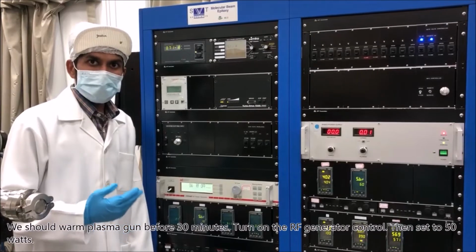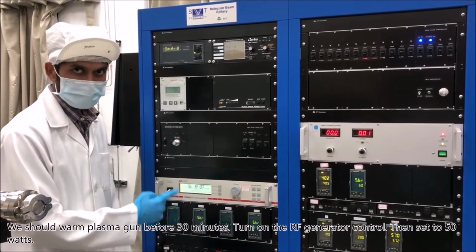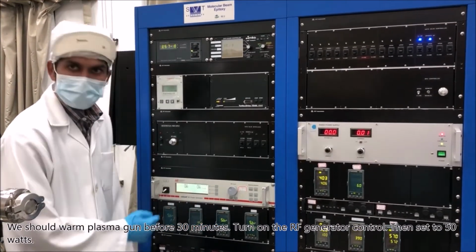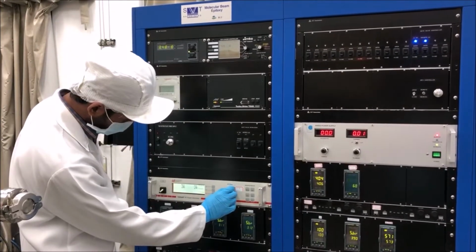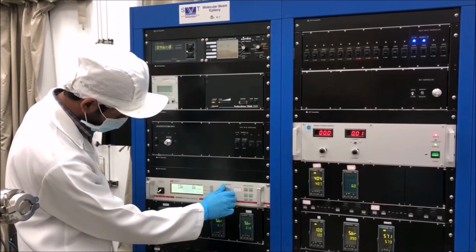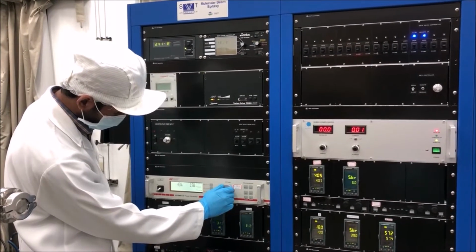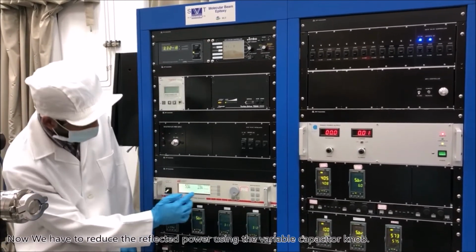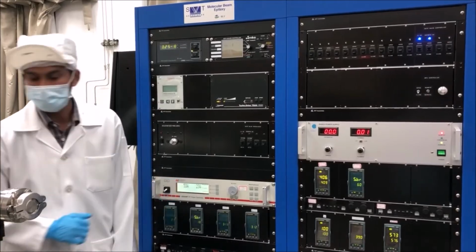We should warm the plasma gun 30 minutes before. Turn on the RF generator control. Then set it to 50 watts. Now we have to reduce the reflected power using the variable capacitor knob.